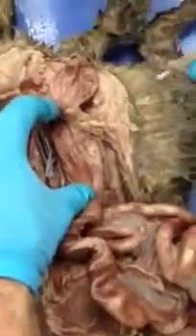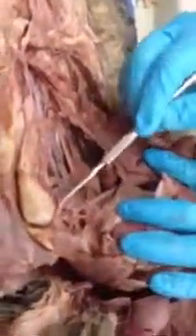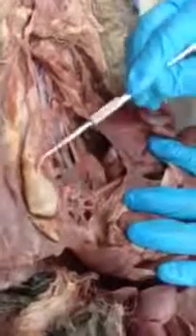And then the large intestine continues down this way and eventually becomes the rectum. So the rectum's down here. And then the anal opening would be back here. As we pull the organs to the side here, we can see behind the peritoneal structure, so behind the mesentery, we have the kidney, so a retroperitoneal structure.